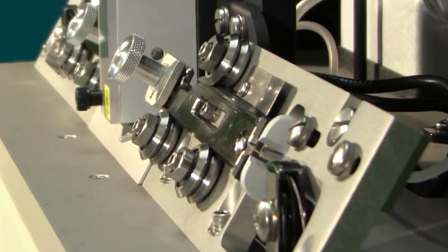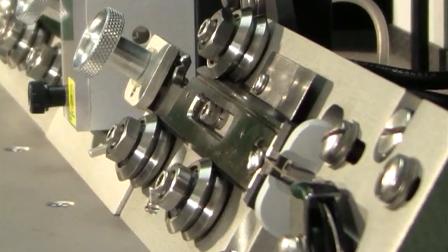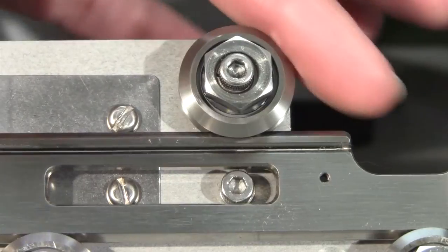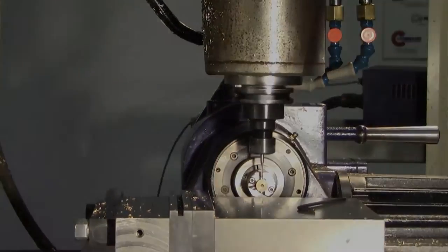Since each puller bar is supported in the V-groove of the bearings, its position is defined by the location of the two lower bearings and the amount of play in the upper bearing. This was adjusted in the factory and will not normally need any readjustment for the life of the instrument.